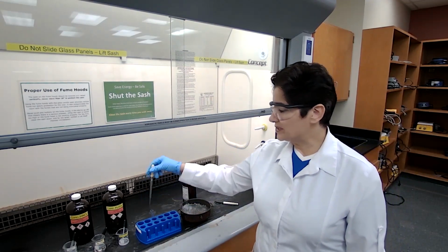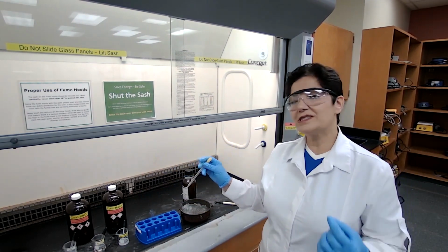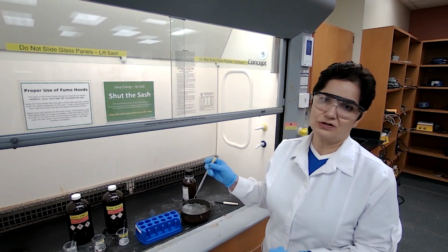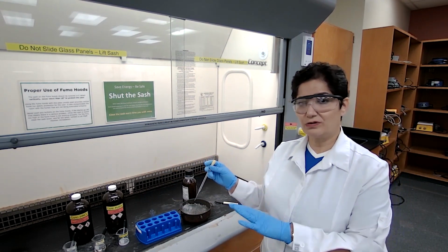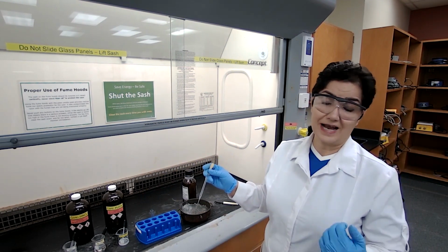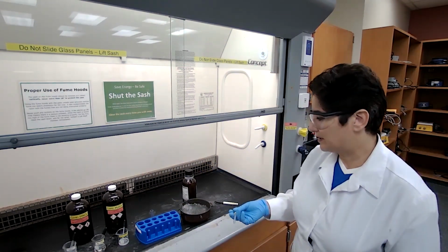Then I'm going to use this micropipette and add the nitronium ion, which is the content of test tube B, 1 drop at a time, into test tube A, which is my methyl benzoate. And wait 20 to 30 seconds in between addition of each drop to assure that the reaction temperature doesn't go high to produce the byproduct.